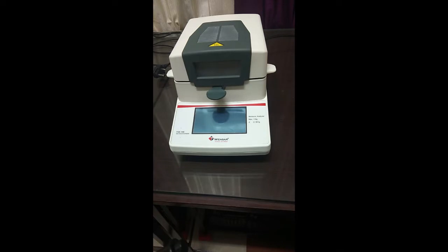In most industrial applications, especially in the food industry, the calculation of moisture is essential, as if a particular food product contains a large amount of moisture, then there's always a chance of bacterial contamination. On the other hand, a lower amount of moisture content may result in dryness of the food product.